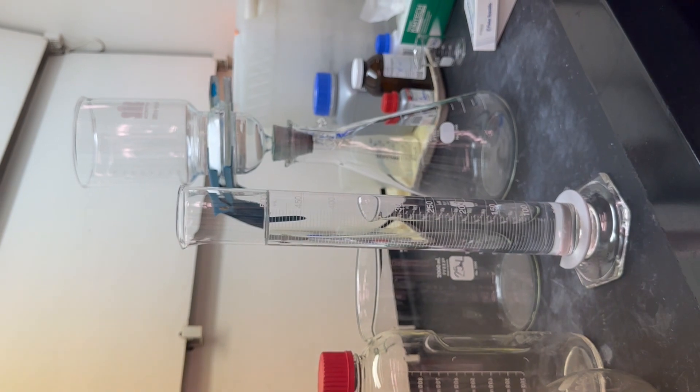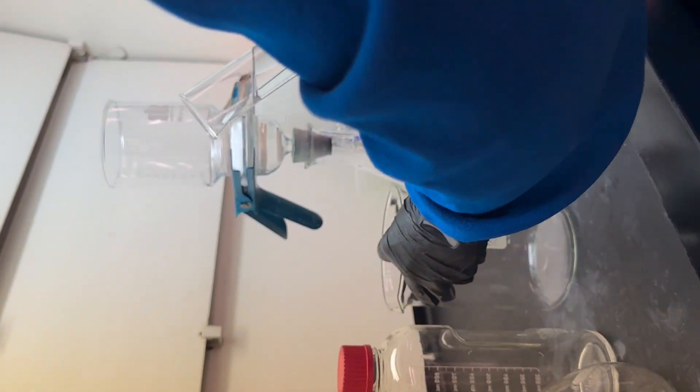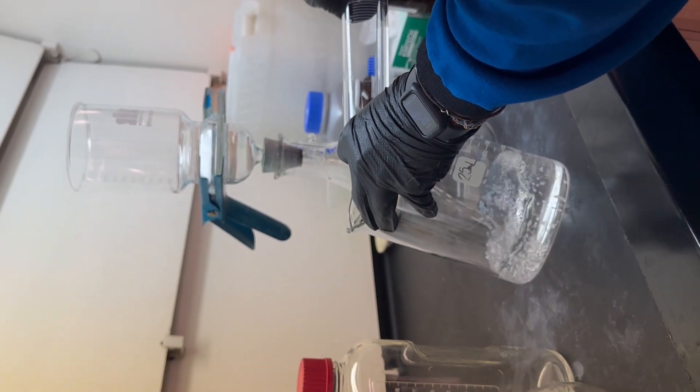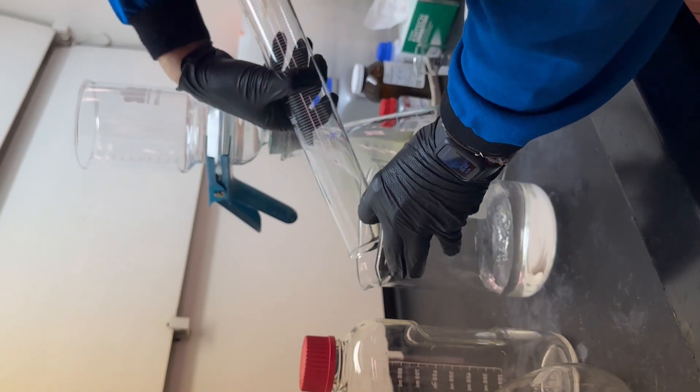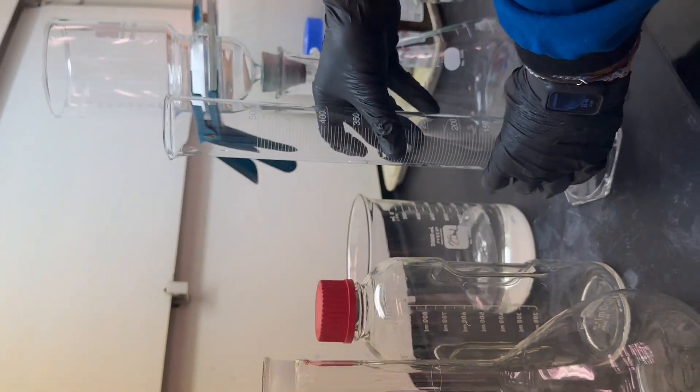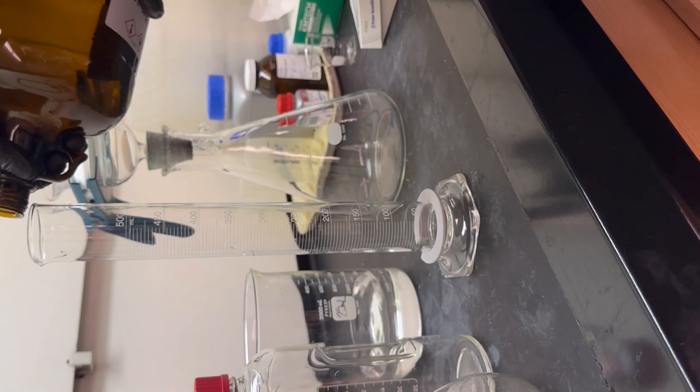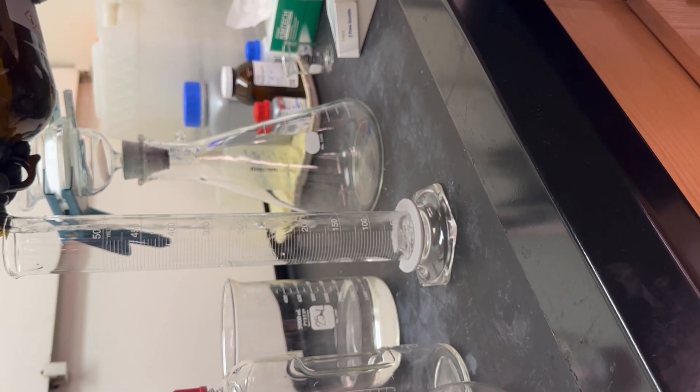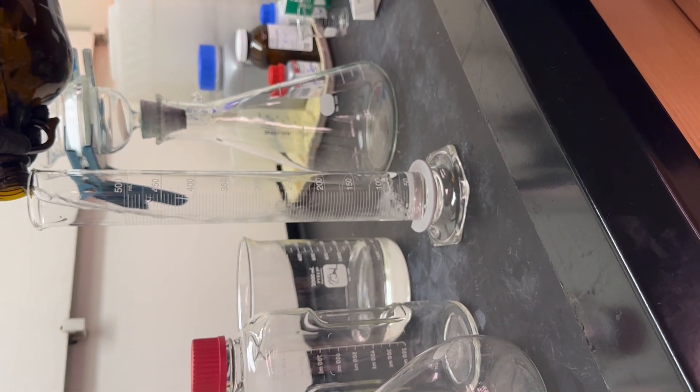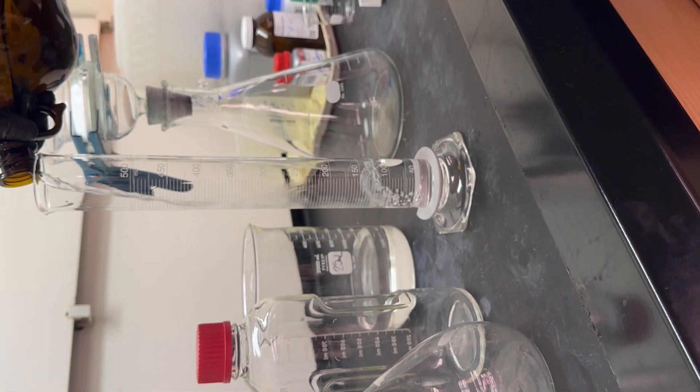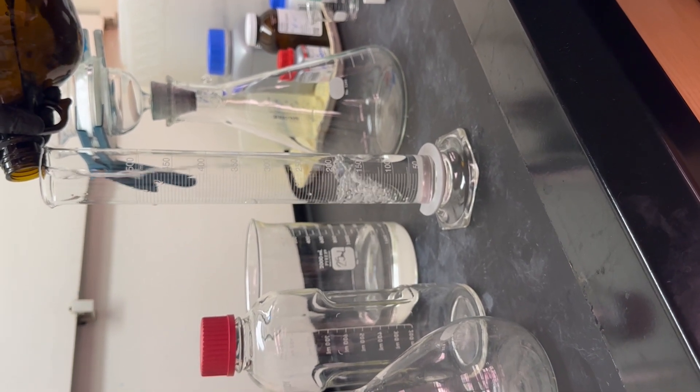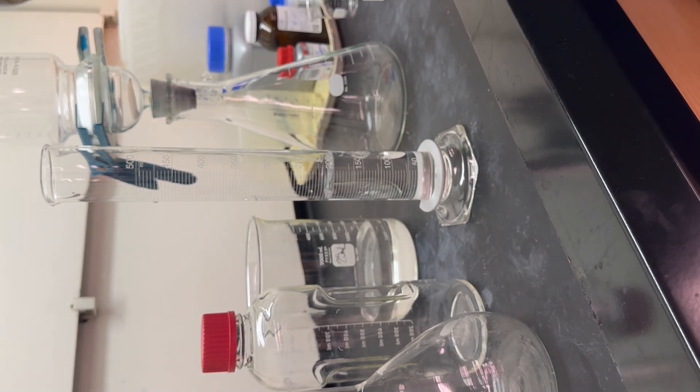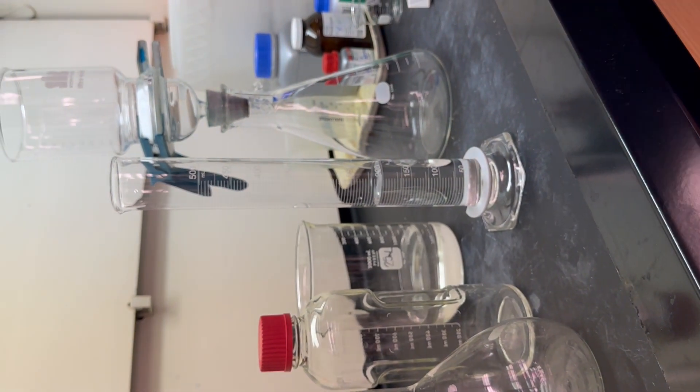That's 500 mLs, go ahead and pour. And then to reach my 700 mLs, I need an additional 200 mLs. It doesn't have to be perfect, but I'm trying to get close.